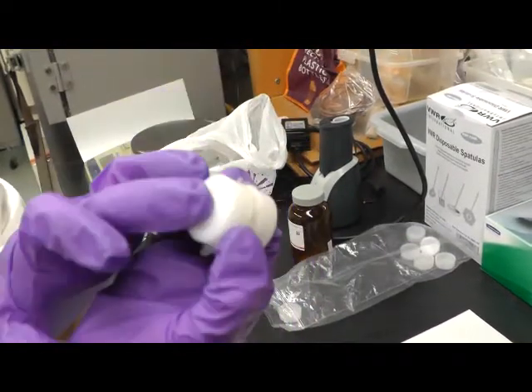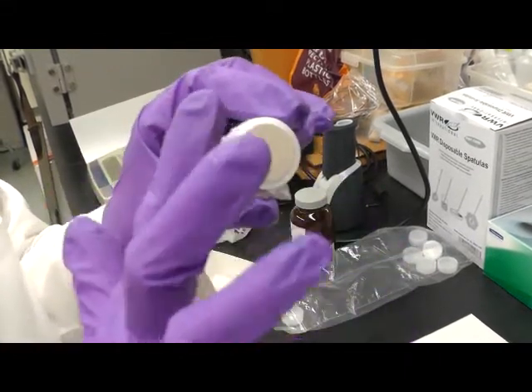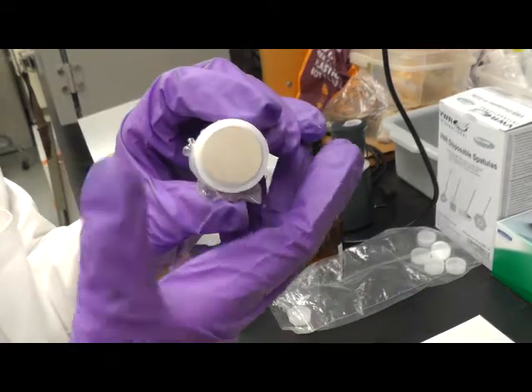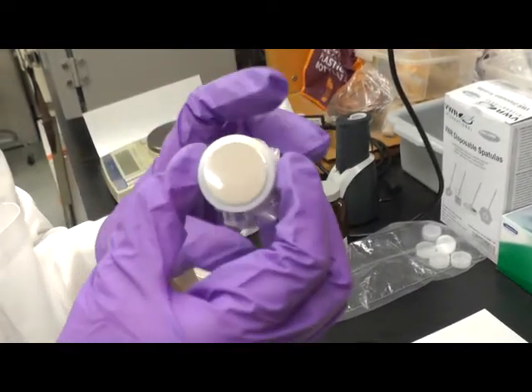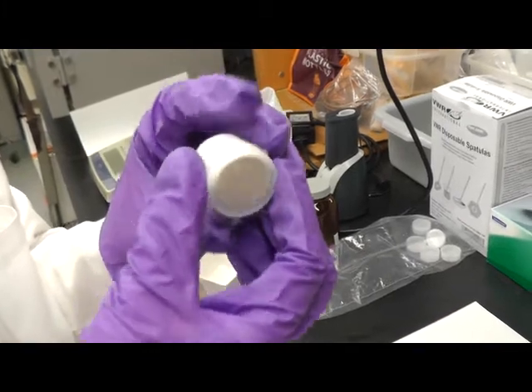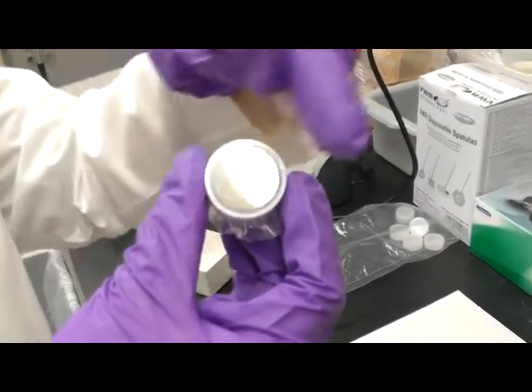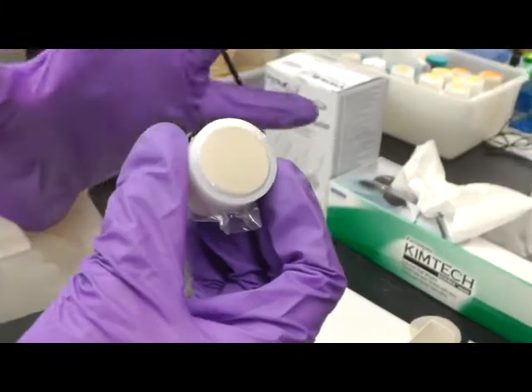But if there is too much stuffing put inside the cup, the surface will be like bulge towards outside, which is also not perfect for measurements. So make sure you put in just enough stuffing. So that creates a really compact soil packing.